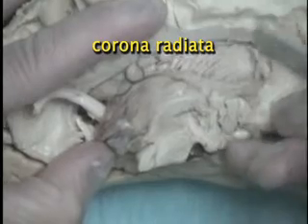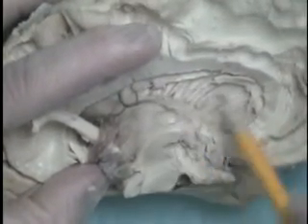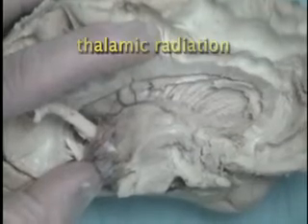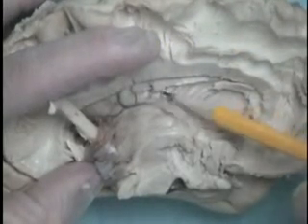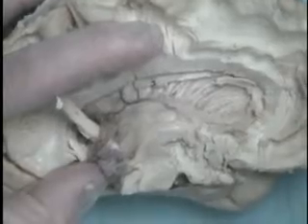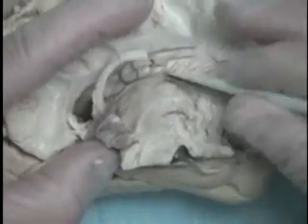Underneath the caudate are bundles of fibers forming part of the radiating crown, the corona radiata. Fibers between cortex and thalamus form the thalamic radiation. If we take away more white matter and overlying cortex, maybe we can follow some of the fibers in the radiating crown into the cortex.